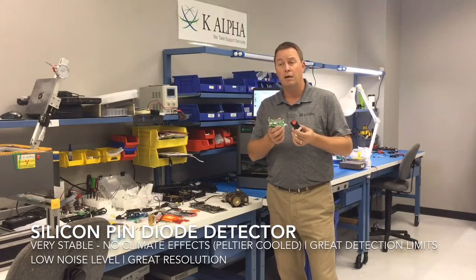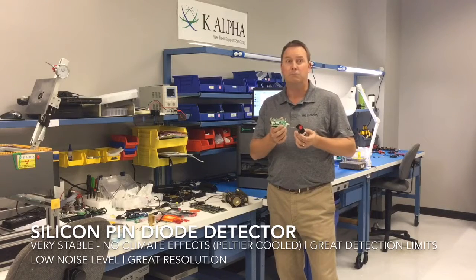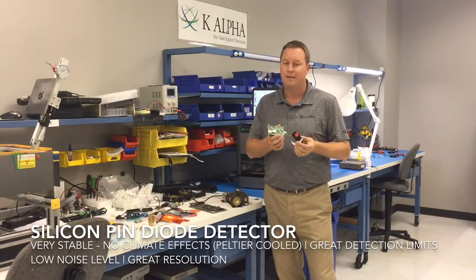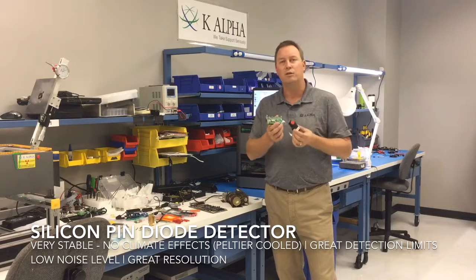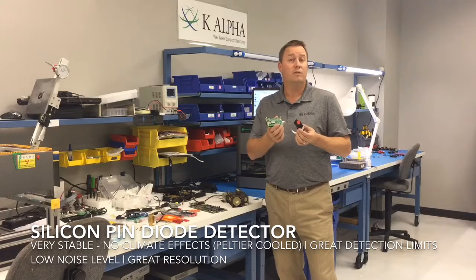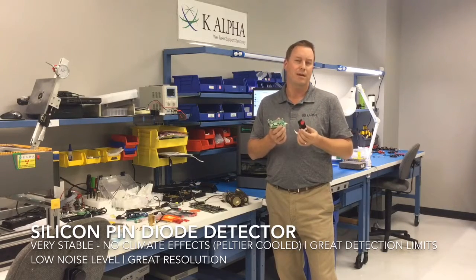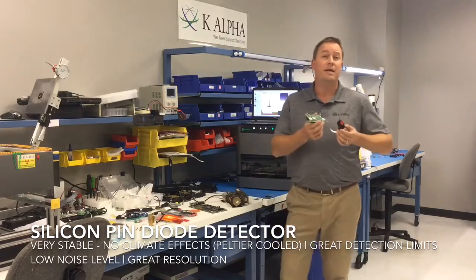So for new applications like ENEPIG, where you're measuring gold and palladium at 2 to 3 microinches or 0.1 microns or less, you really, really need that low base level. You need that high signal to noise ratio, which the solid state detectors achieve. They're also a lot more stable over time. Again, since it's solid state, you're not going to have those fluctuations with temperature and humidity, so you're not going to have to recalibrate nearly as often. So this is the PIN detector.